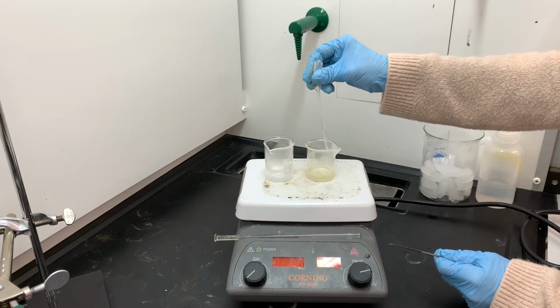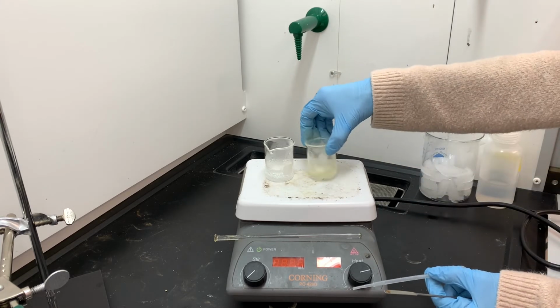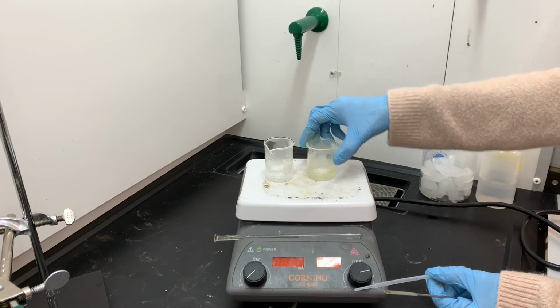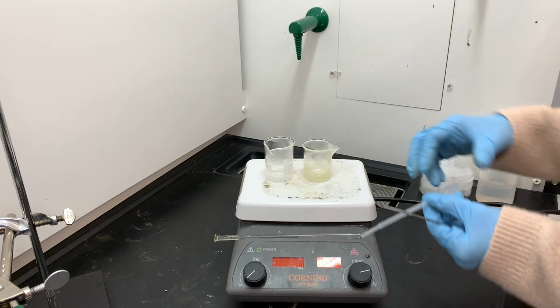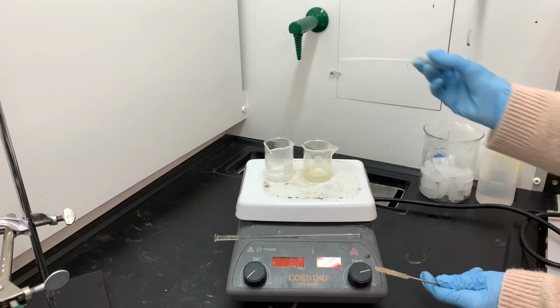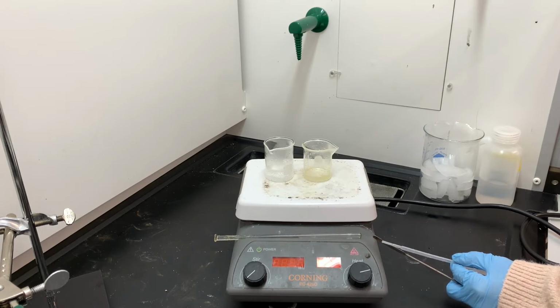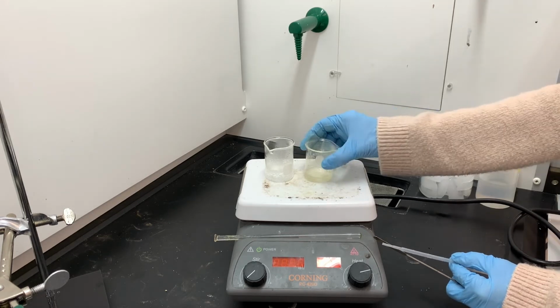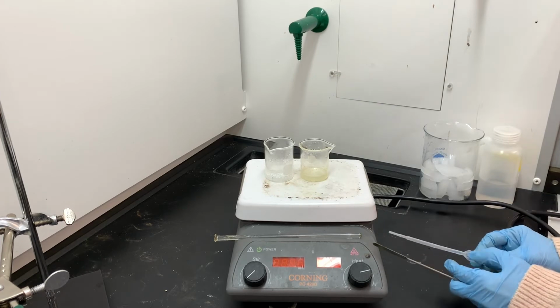Now, if you're feeling a little nervous about how I've used that pipette to suck up some solution and then used it to suck up water, it looks like cross-contamination. In normal situations, that would be a really bad thing to do, but since I'm recrystallizing, I'm just transferring that water into the right-hand beaker anyways, so it's okay to cross-contaminate. And it's important in the recrystallization process to be patient, to give the solution a chance to heat up sufficiently before you decide that you need to add a little bit more water. So that's what you see going on here.